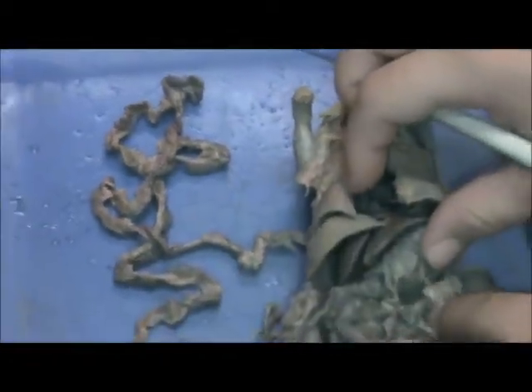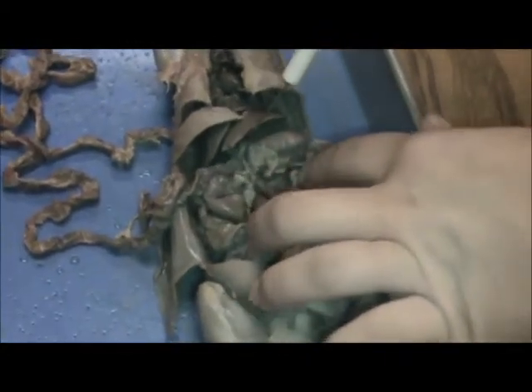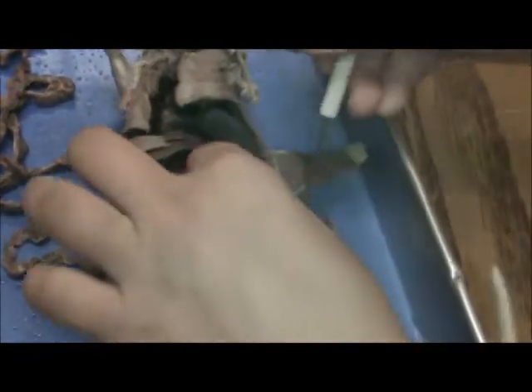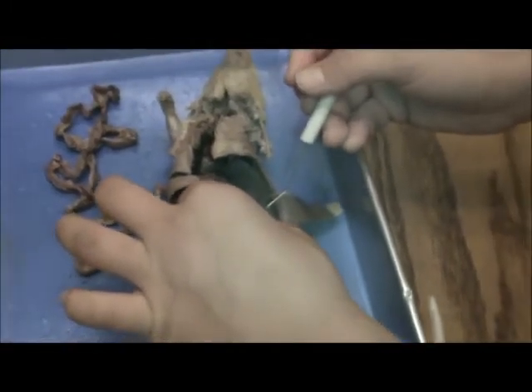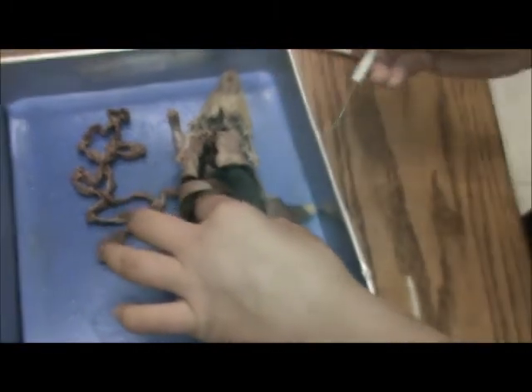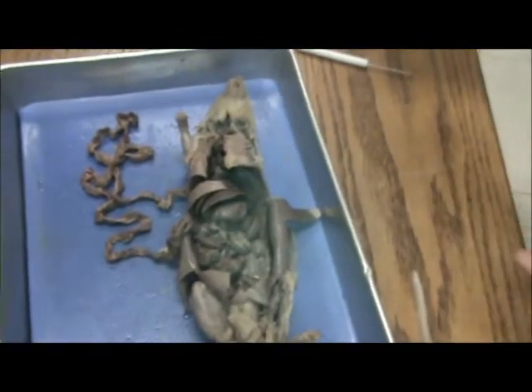The mesentery kind of got cut away, but it's white gooey stuff that holds the small intestine in and other organs around there. You can see some in here. It's a thin connective tissue that holds the small intestine in place. And then the spleen is this right here, and it participates in the creation of blood cells and also helps to filter the blood and fight infections. It also helps control the amount of blood circulating through the body, and that is Fernando's digestive system.